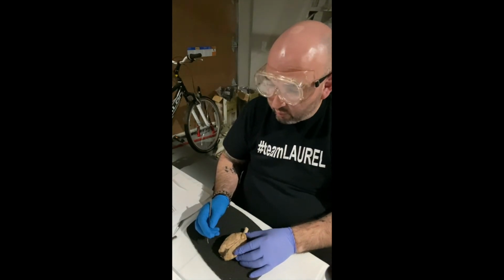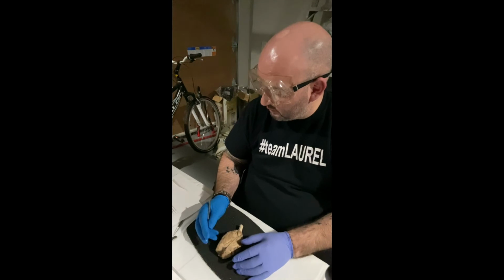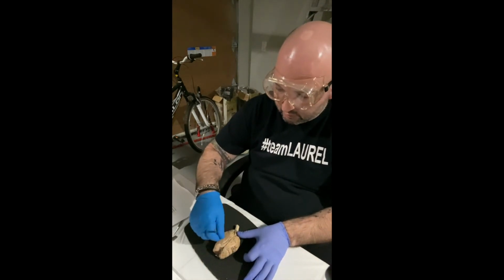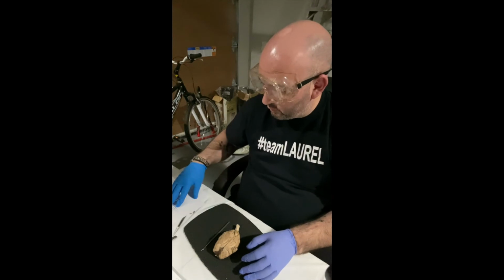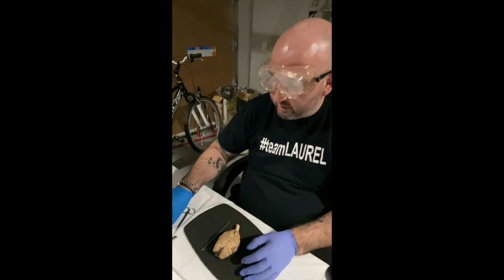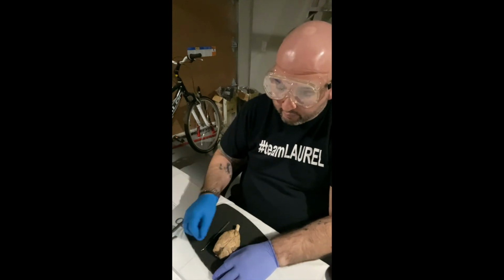The temporal lobe of the brain is where sound is processed. It's a region where auditory, language, and speech comprehension systems are located. And this is our temporal lobe. Okay, now we're going to go ahead and move on to actual separation of the brain.